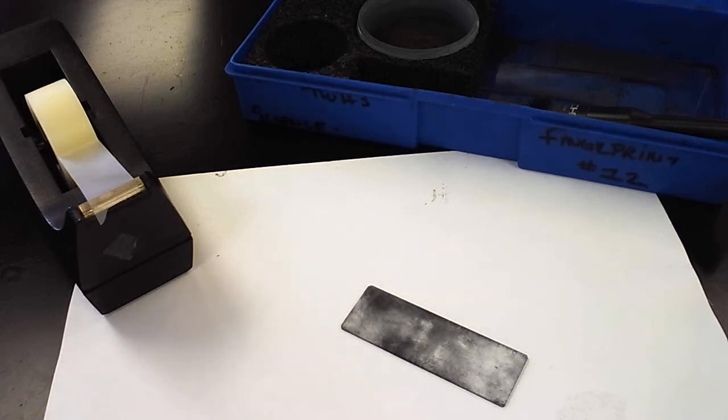This is the video set of instructions to talk about dusting for fingerprints. I want you to pay close attention, especially to this station, because this is going to be our prime method when we go out in the school building, either later this week or most likely next week, to actually dust for fingerprints.